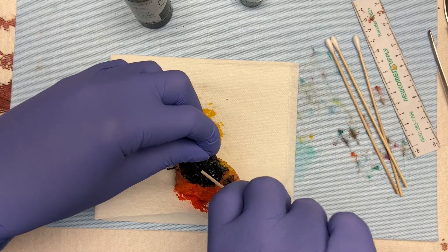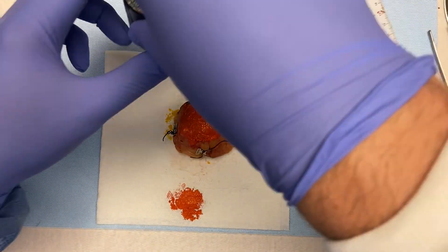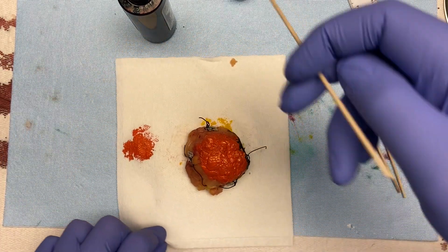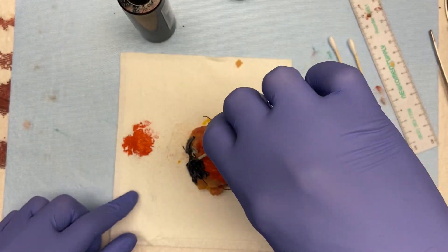One important thing: do not remove the orientation markers — whether you're using stitches or metal tabs — until after you've inked. I know you think you've got the orientation memorized and can remove them to make room for your ink, but don't ever do that. That's a disaster waiting to happen.